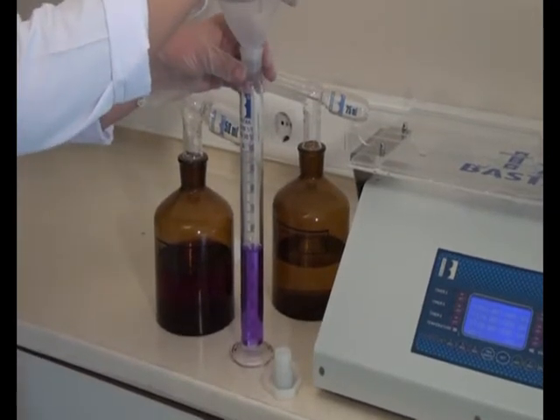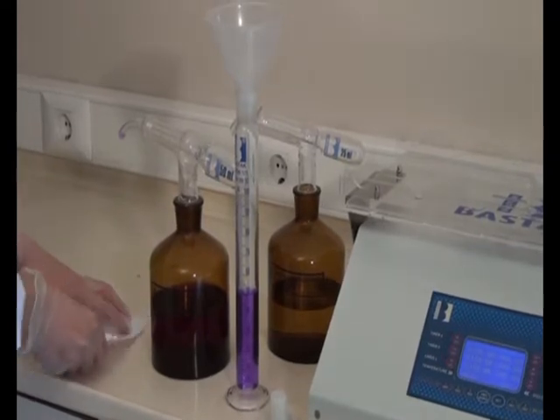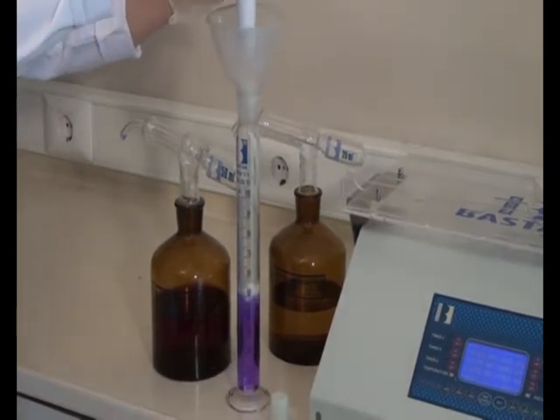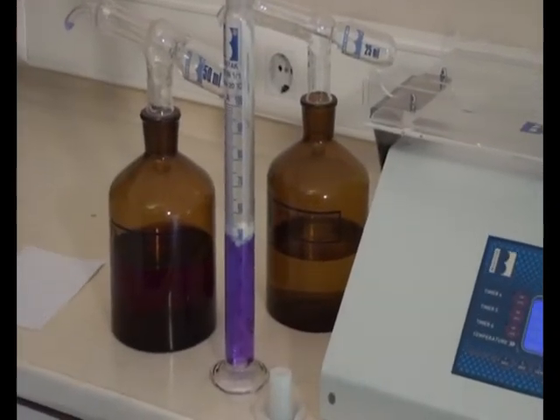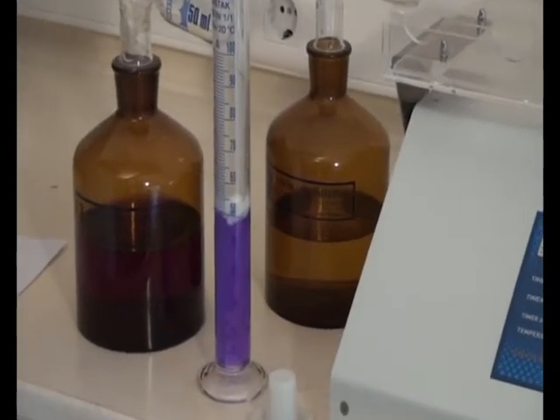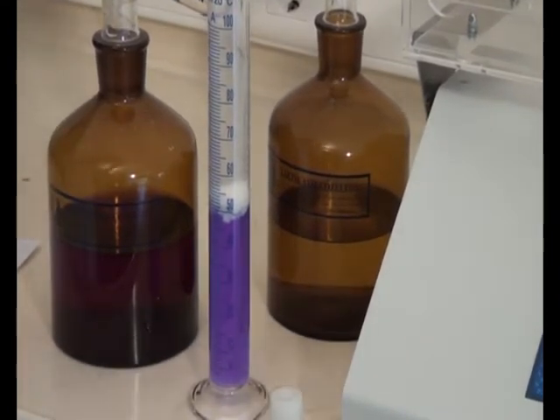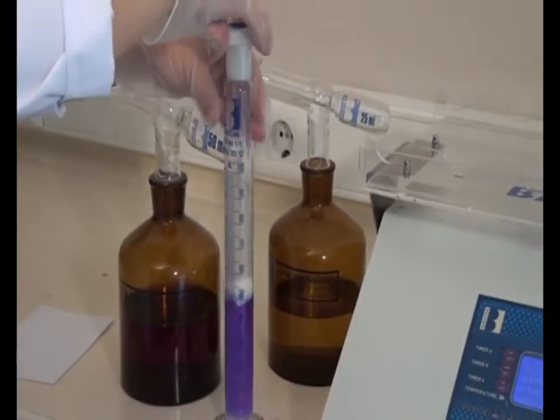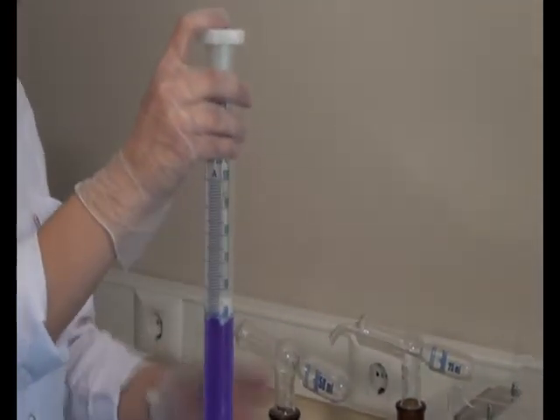The 3.20 gram sample is transferred to the tube using a funnel. The cover is closed very tightly. The tube is shaken 10 to 12 times.